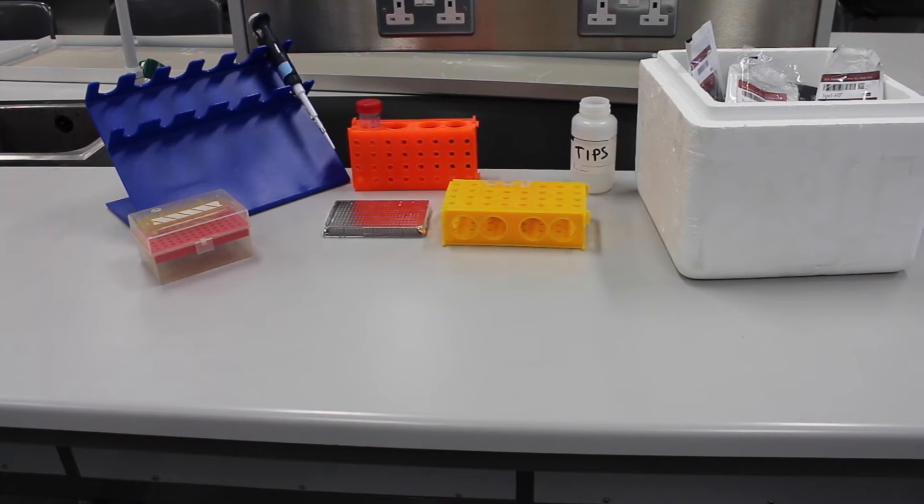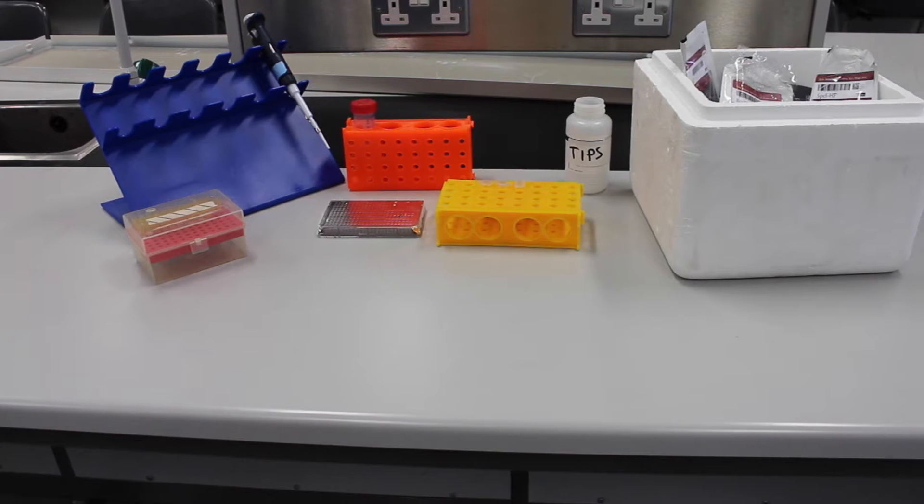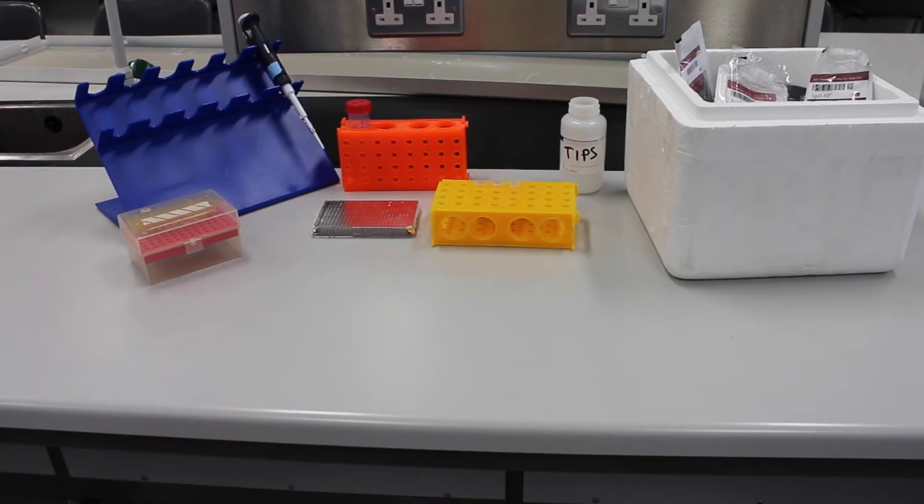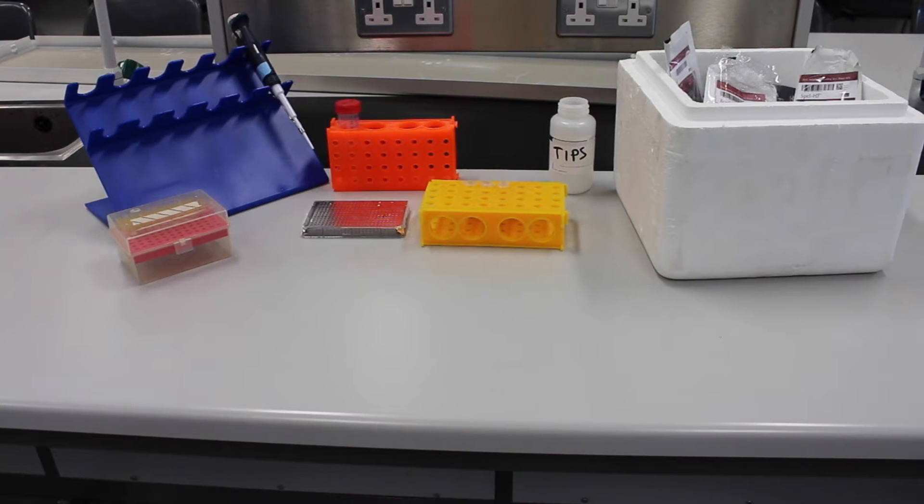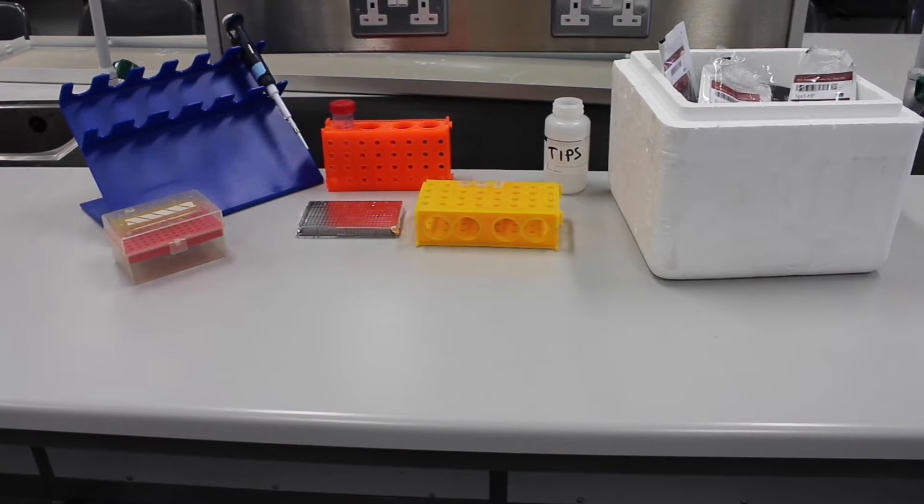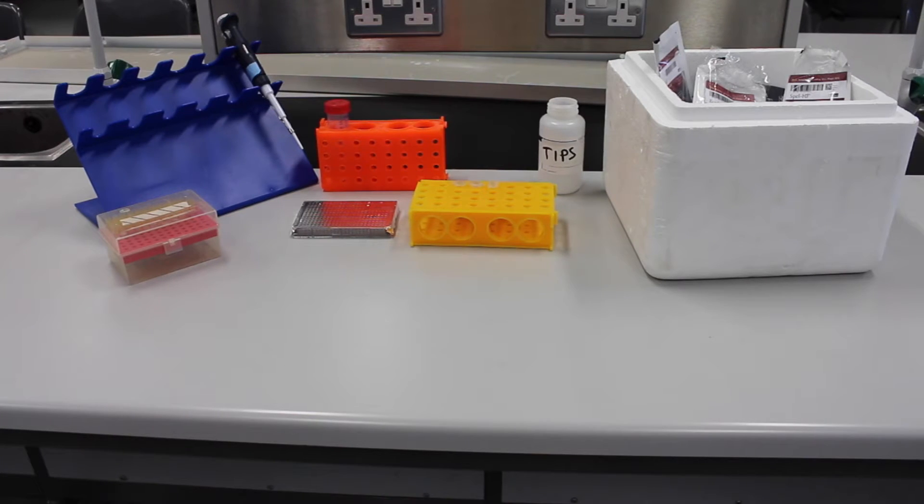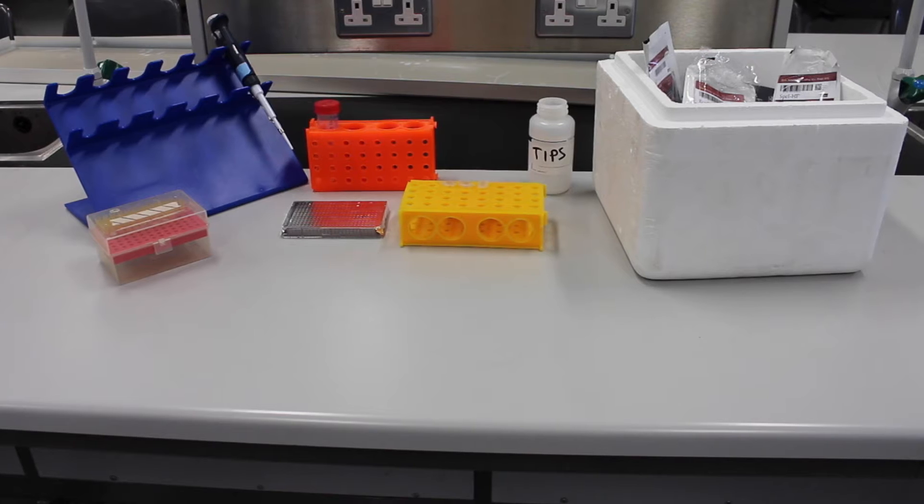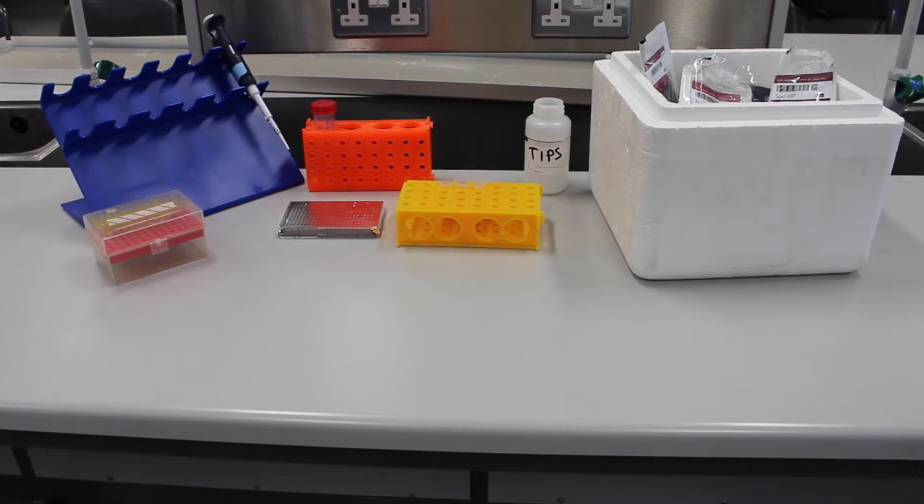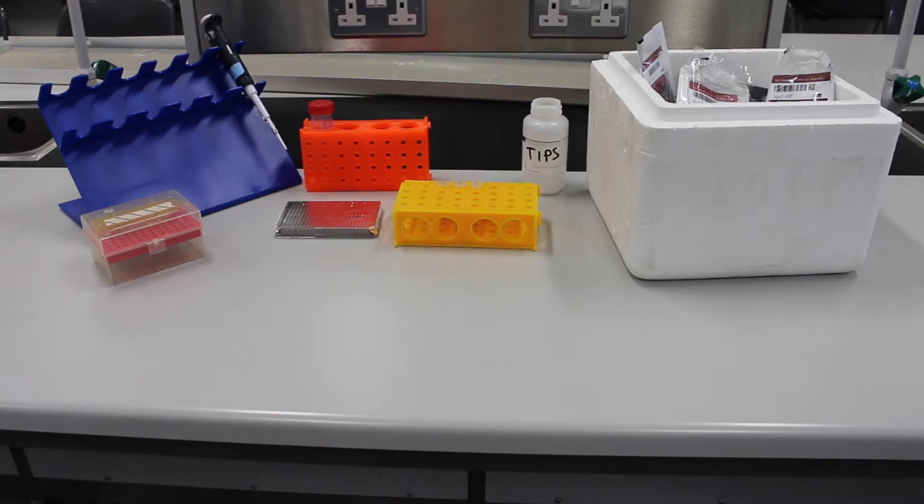BioBricks are Lego-like standardized strands of DNA that allow you to form synthetic biological systems. This BioBrick 3A assembly technique allows you to put two BioBricks together. The video includes the protocols for the digestion of the input DNA molecules and the ligation of the digested parts to form a circularized plasmid.